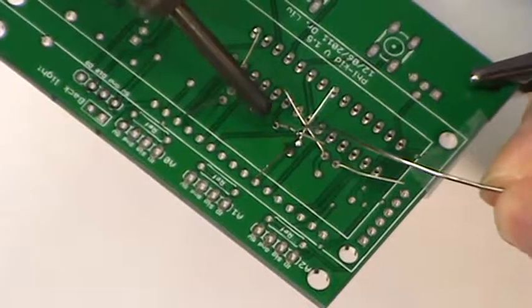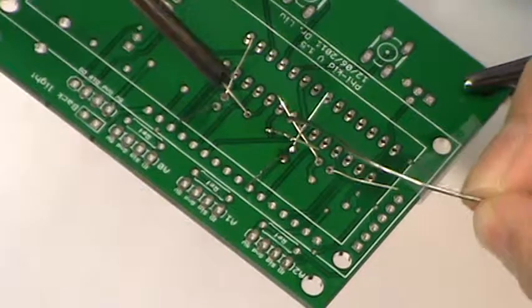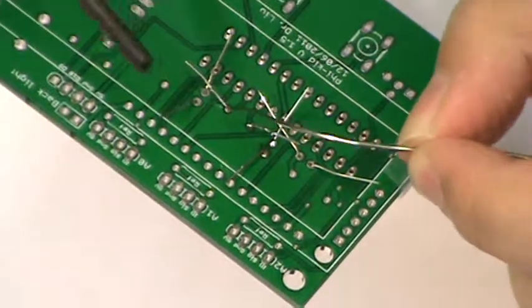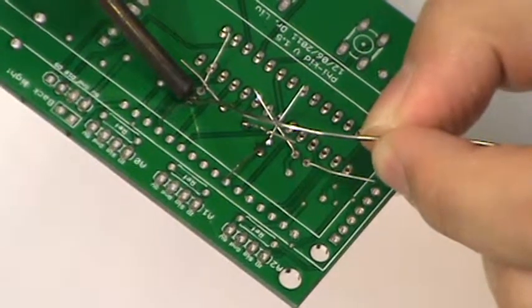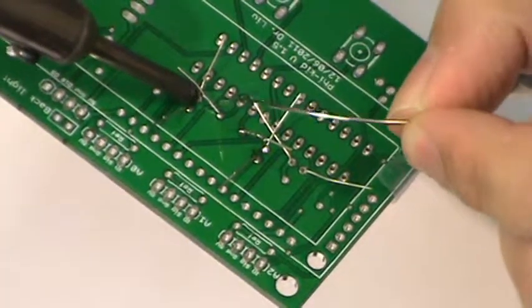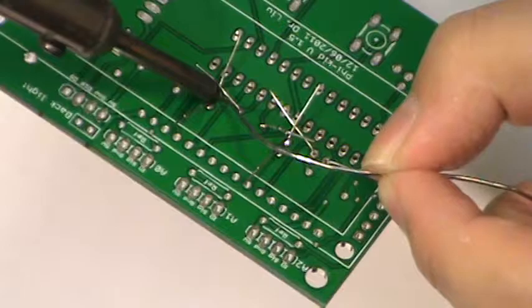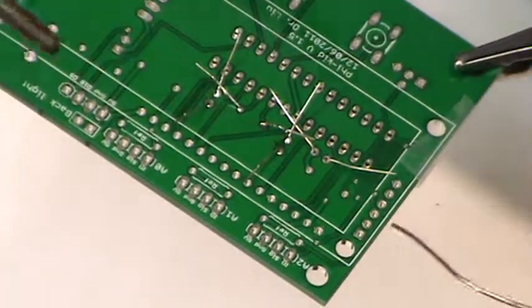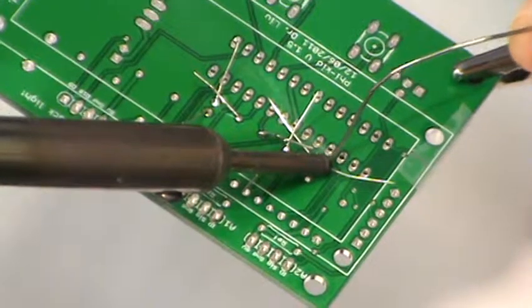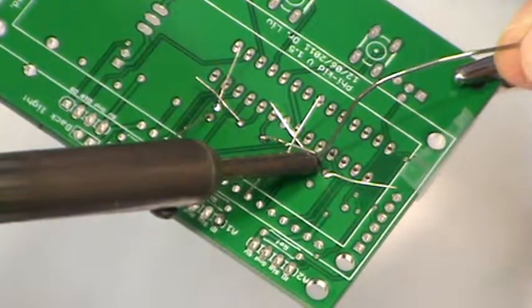Okay, so as you can see, I'm already getting a little obstructed by all those pins. So you don't really have to secure a lot of pins at a time. Just do a few of them at a time. Okay. Alright, like this pin over here gets a little bit obstructed. I think I was able to get there. Okay, so don't really need a lot of solder, just a little bit of work.